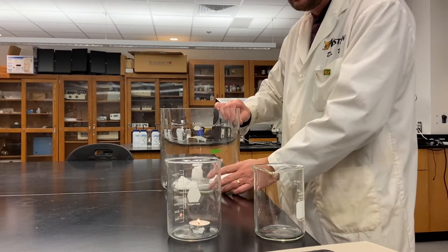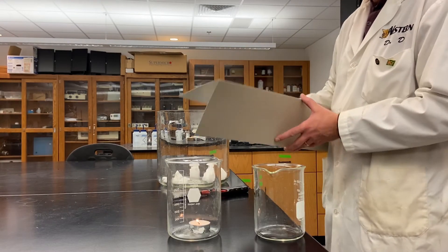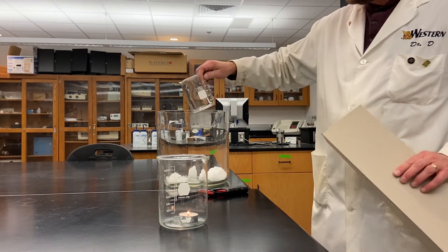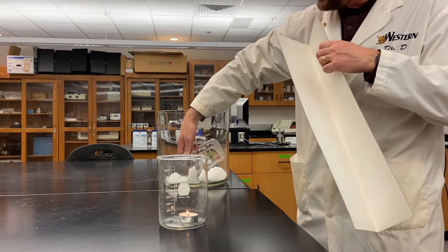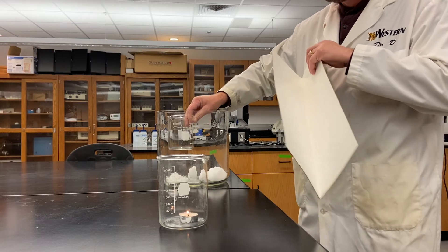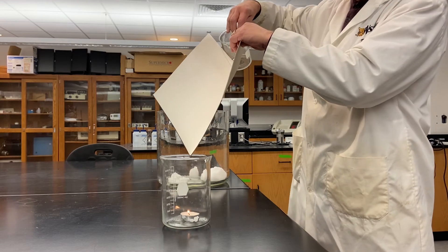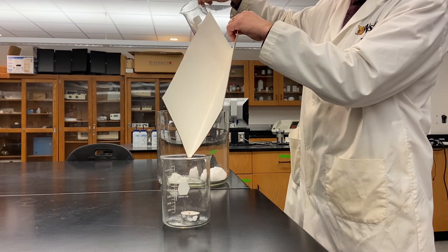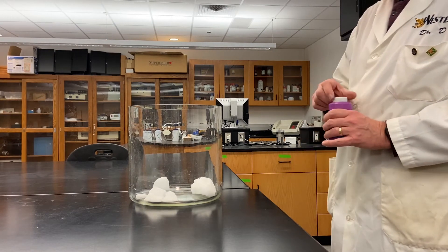I am going to pour some carbon dioxide down this trough into this beaker. I'm going to dip into my container, get some carbon dioxide out, and place it above this container. Here we go — I'm pouring my carbon dioxide down that trough, and it extinguished my candle.